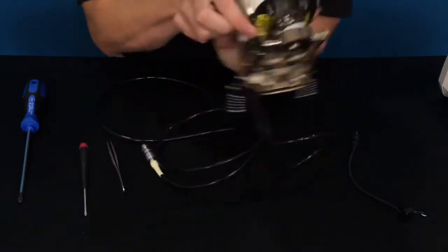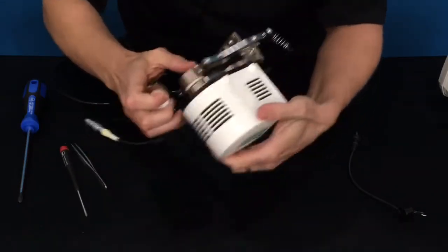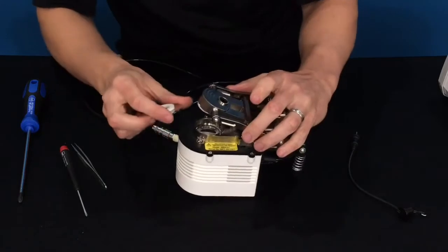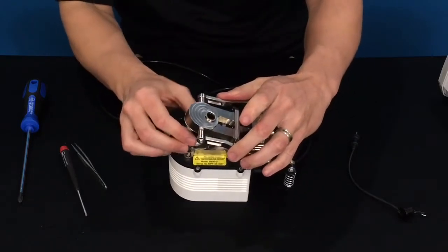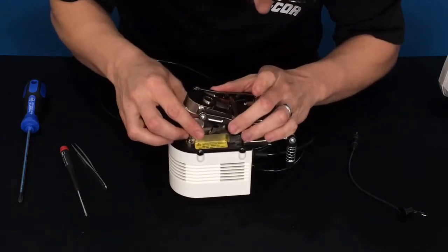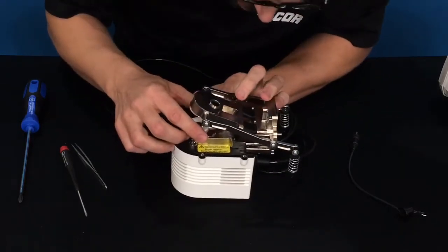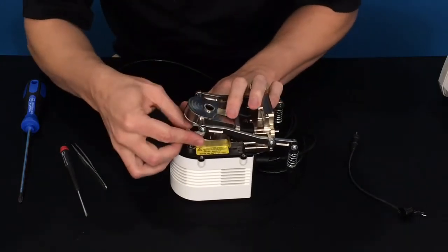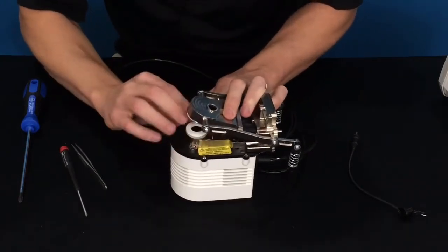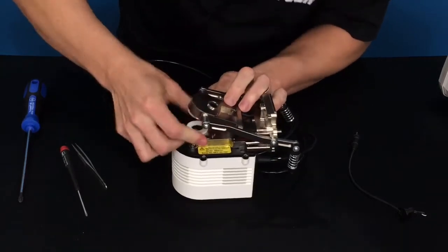The notch is on the other side of the top aperture, and it's the same piece. It's often easier to put it on upside down and line up those two notches. This is also why it's easier to install the apertures before you install the chamber if you can. It should pop into place.